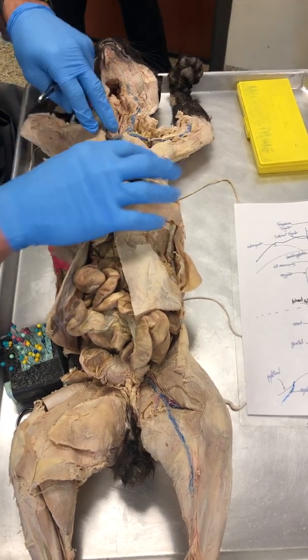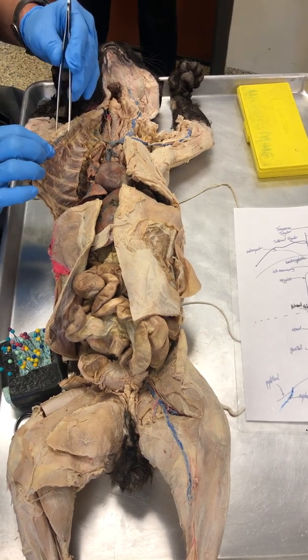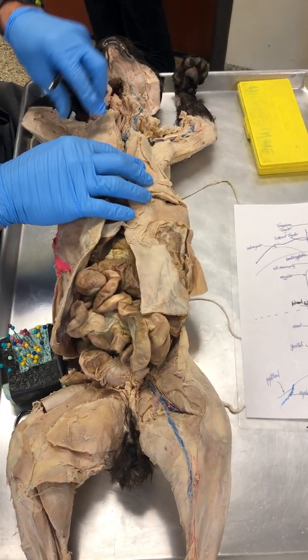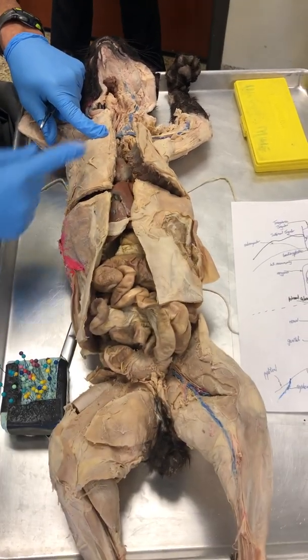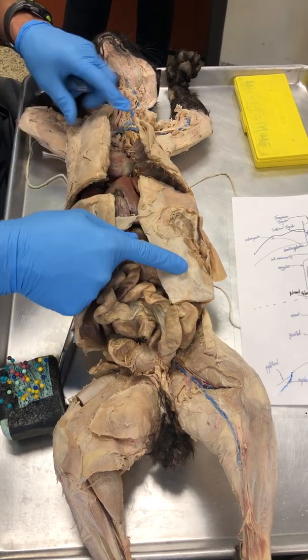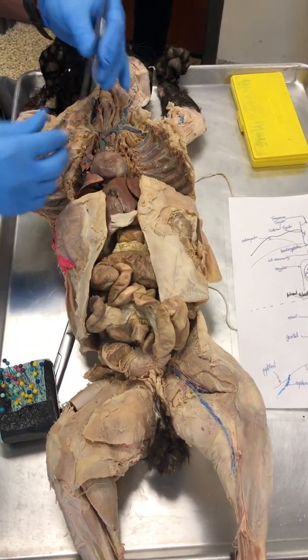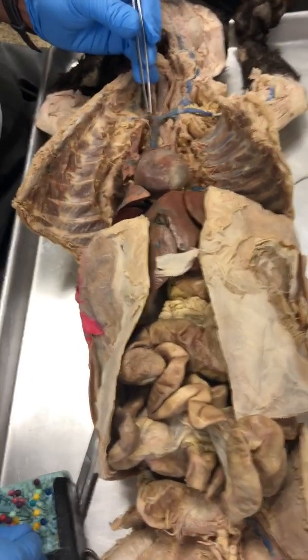So there's the muscle right there, folks. There's my sternum right there. And there's the costal cartilage that we cut through. So the internal mammary vein is going to run from the mammary glands, or where it would be, into the superior vena cava. So notice, it is a 3-dimensional structure, because that is the internal mammary vein right there.